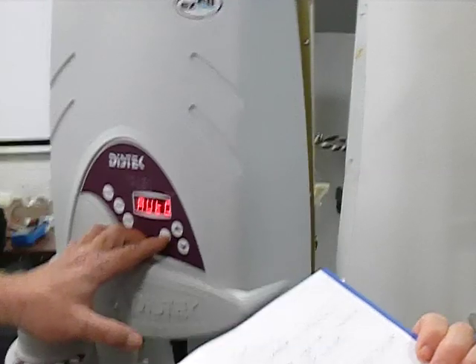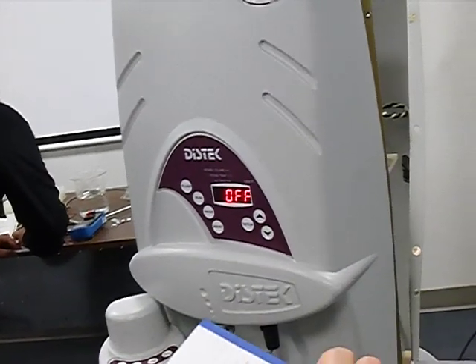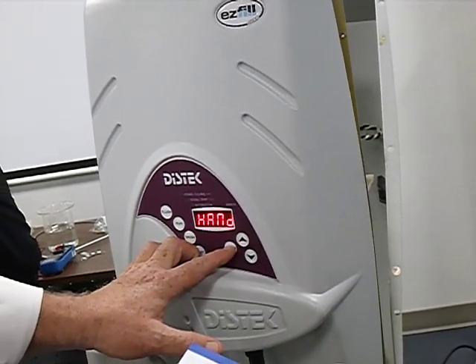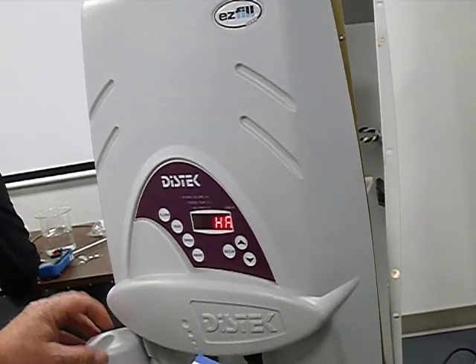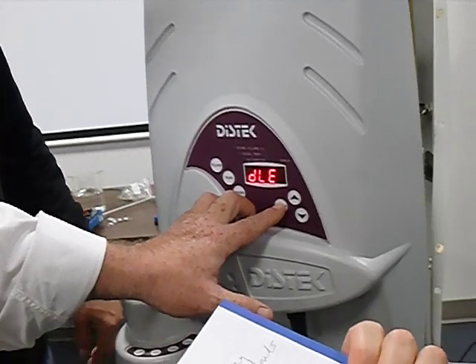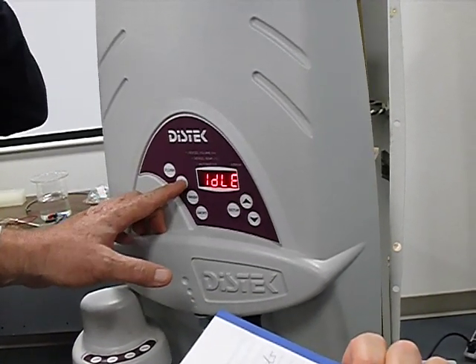The autofill is one attachment, the carousel that spins around on the bottom. We don't have that, so we're going to keep that off. We've got the handle, that is going to be on. So now we're set up. Now we're going to run it. And tell me, what do you think the difference is?